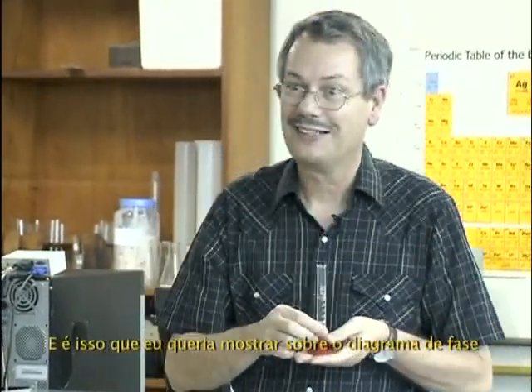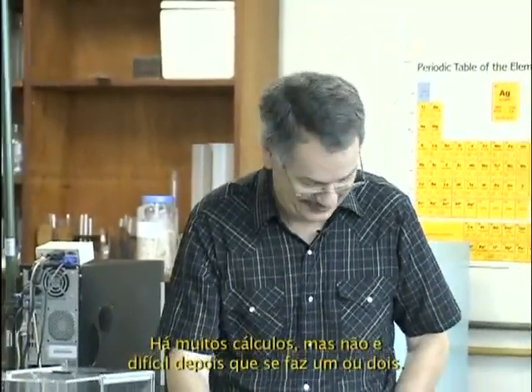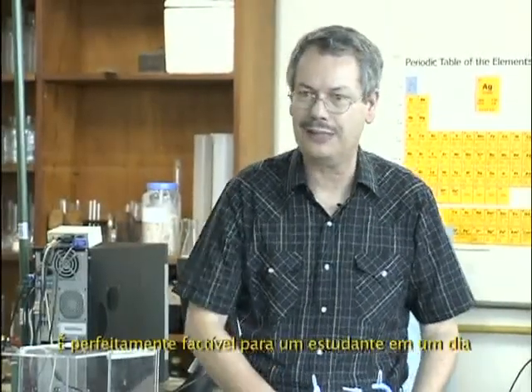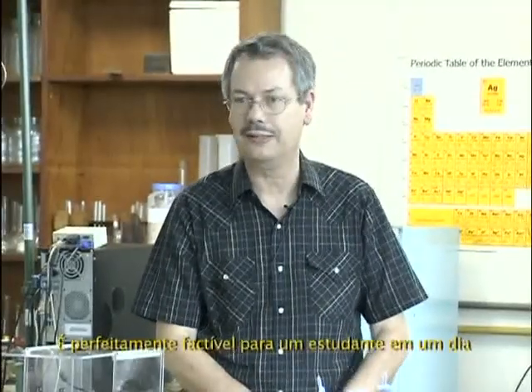That's it for what I wanted to say on the phase diagram. I know there is a lot of calculation, but it's not very difficult once you make one or two. It's really doable by a student in one day. Questions?